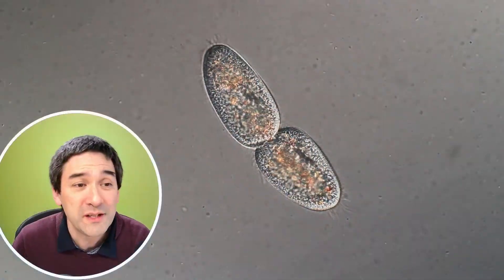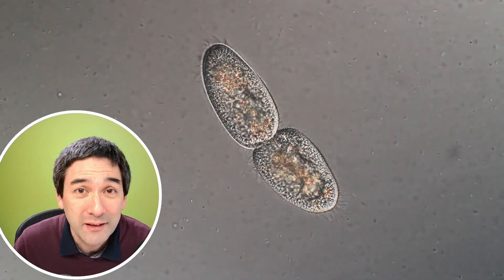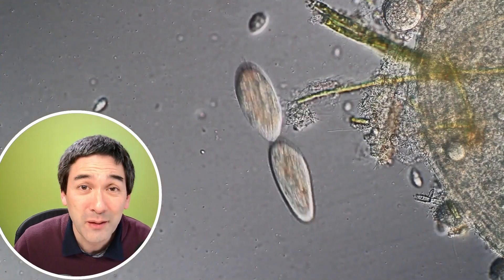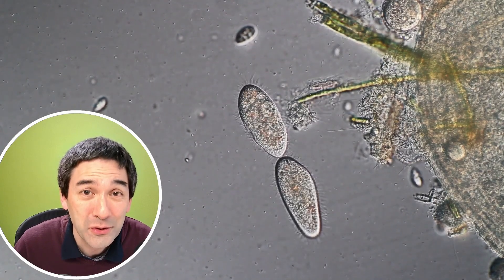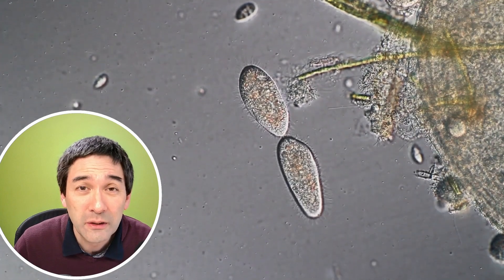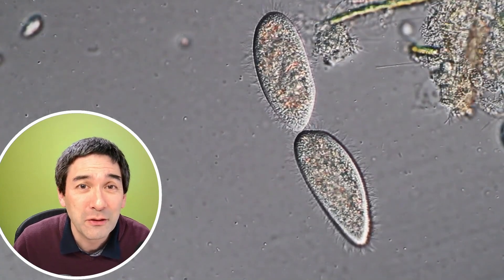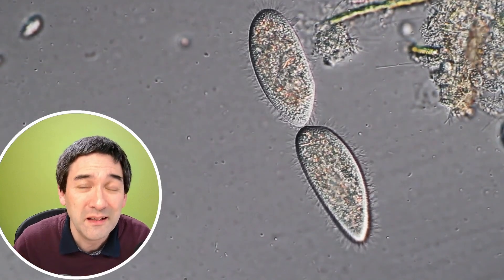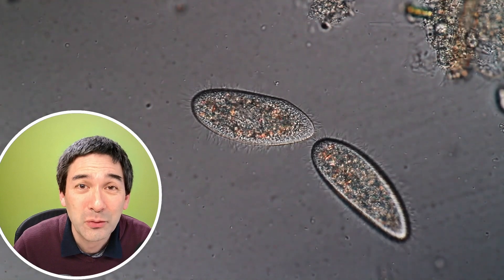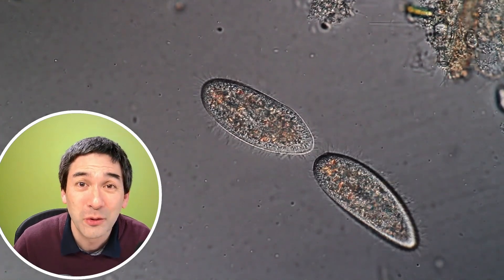What I would like to show you here is a dividing cell — a dividing paramecium. You can see that they're still connected, so the cell division process has not completed yet. This takes a couple of hours. I was kind of following it along, maybe an hour and a half or two hours. Slowly they started to separate more and more. At the end, they were only connected very lightly over the tiny cilia. After a couple more minutes, they were able to completely part ways and the whole cycle repeats.